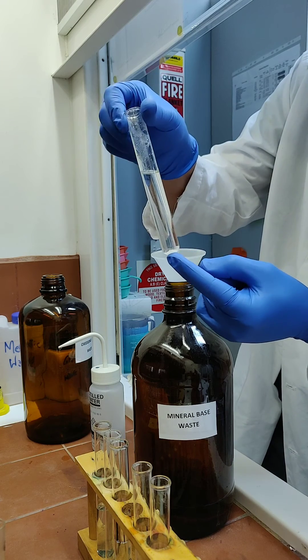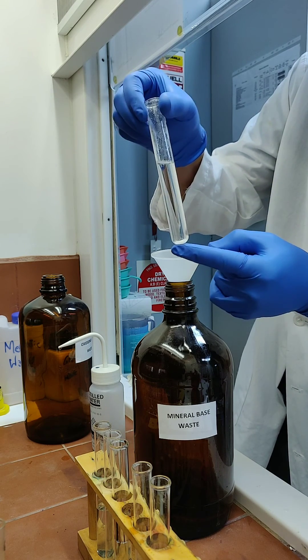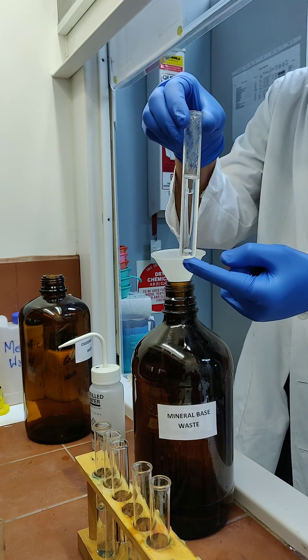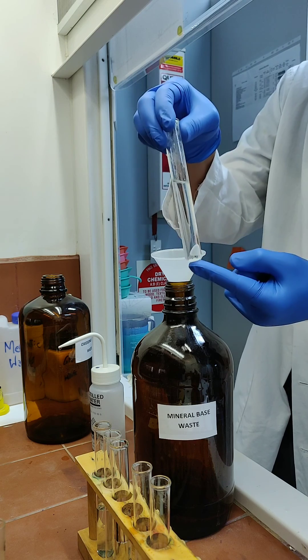As you can see, there are some sodium hydroxide crystals at the bottom of the tube, so I've replaced the solvent with water and I'm going to leave that to sit to allow the sodium hydroxide time to dissolve.